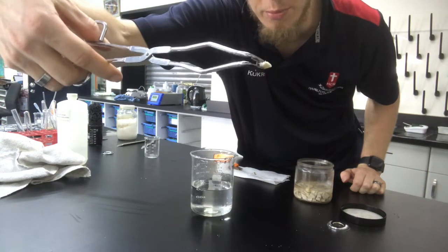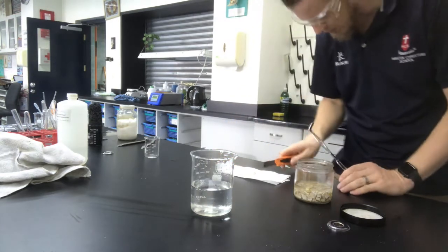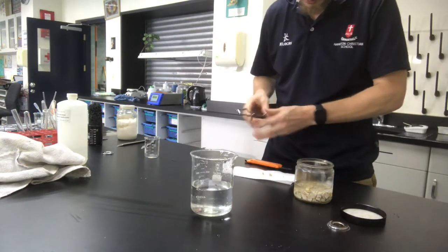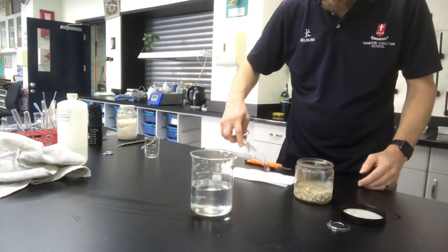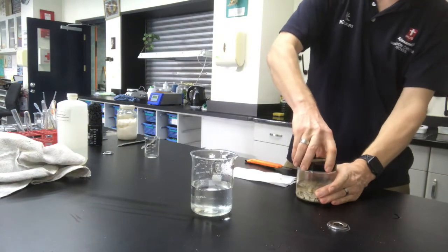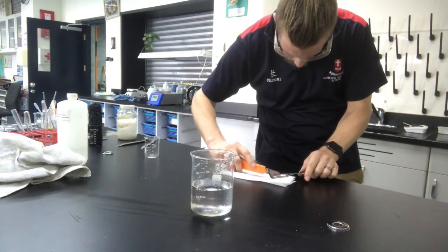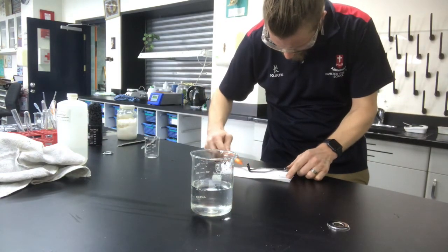the metal. Now if I dropped all of that in the water, I would get quite a big reaction, and it'll be quite dangerous. So I'm just going to take a little piece and put the rest of this back under the oil, okay, because I don't want that reacting. Put that lid on nice and tight. I'm going to put that away. So even this piece I feel might be a little bit too big to kick off with.